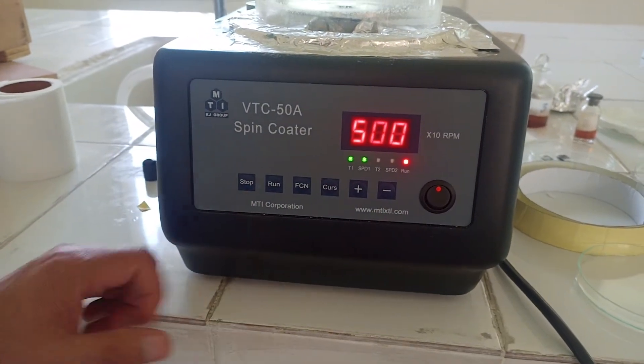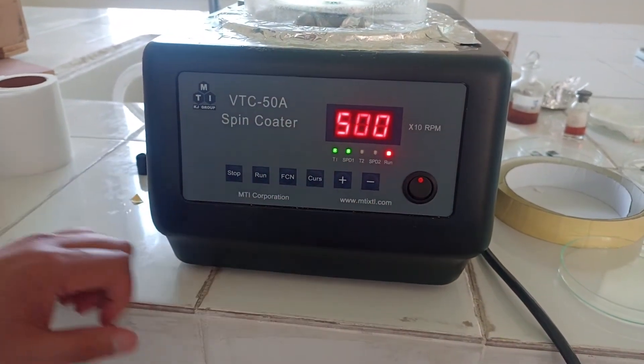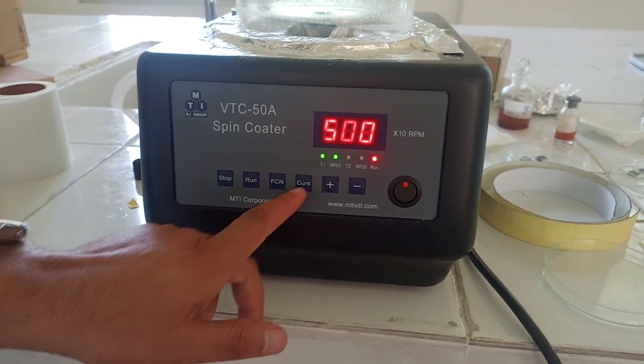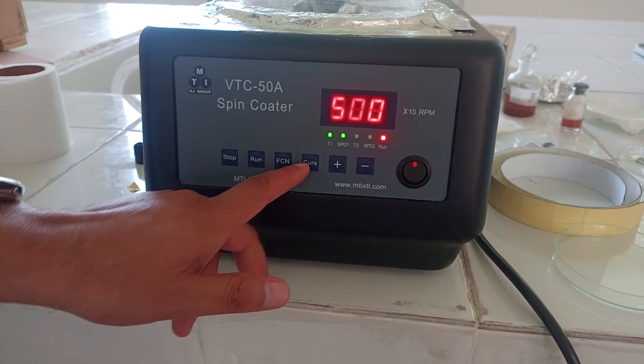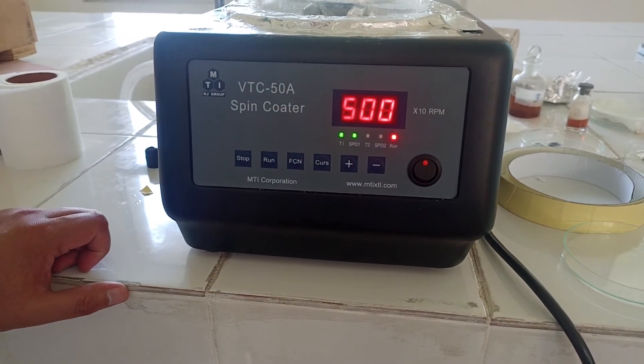After one minute it will stop, and we can stop it from here by using this button. This is power on-off button, and here is the cursor. We can point our cursor here to set our reading.